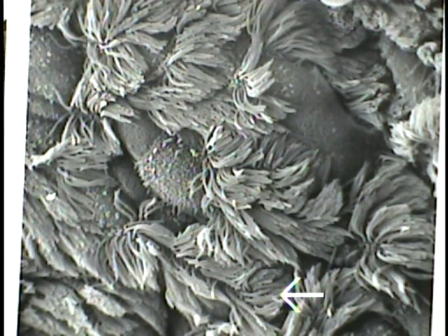So this particular scanning micrograph is excellent at presenting the three-dimensional features of these cell surfaces, in this case illustrating the clumps of cilia on the cell apices of some of the cells, but not all. One should always remember that there are a number of cells within the tracheal lining that reach the top that are not ciliated.